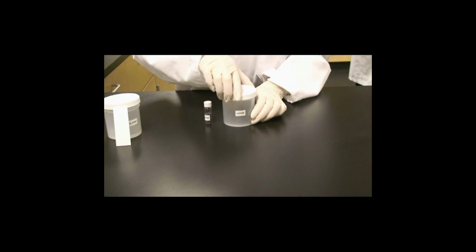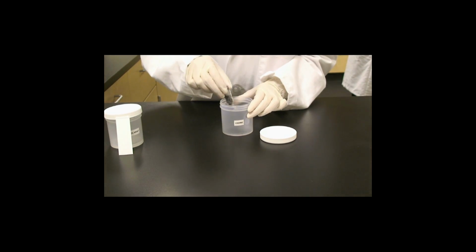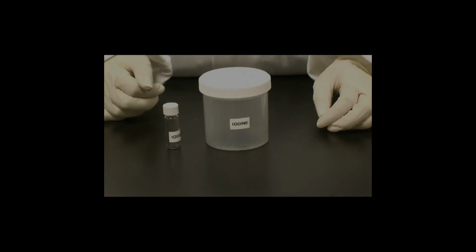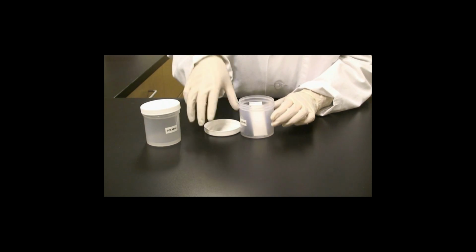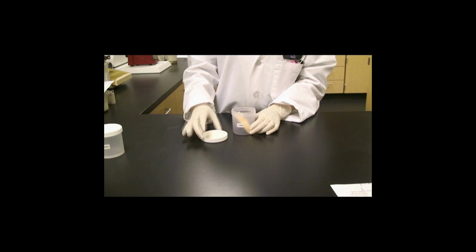While the TLC plate is drying, prepare the iodine chamber. Open the iodine chamber and pour in the iodine crystals. Close the chamber and wait for the TLC plate to dry. Once the TLC plate is dry, open the chamber and place the TLC plate into the chamber. Close the lid and allow the TLC plate to develop for about 15 minutes. The plate should look like this.